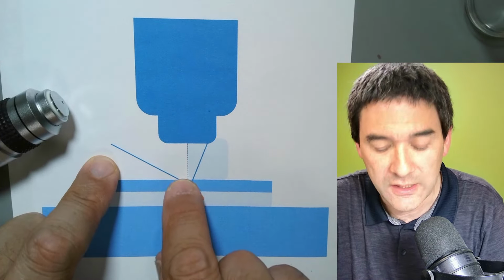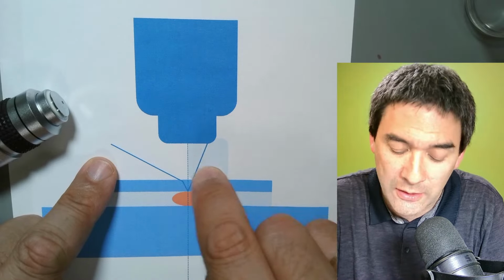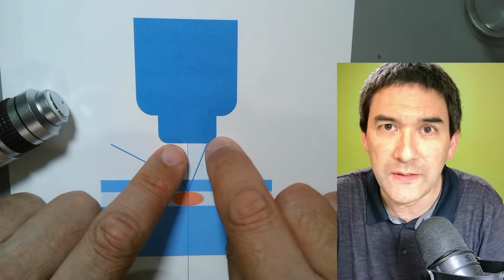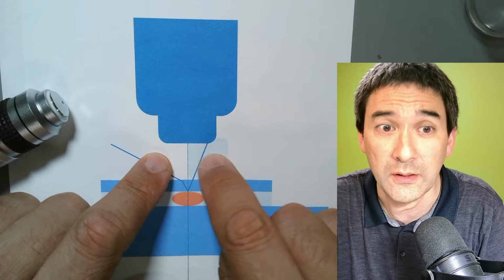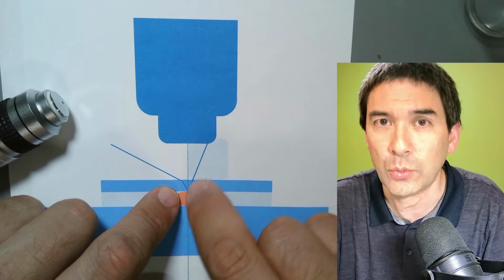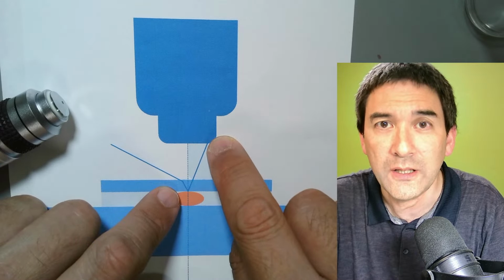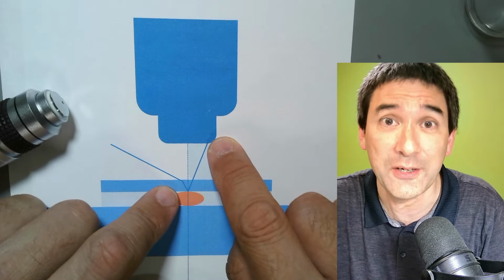This basically means that the image is going to be darker and also of lower resolution. And if you now add immersion oil directly on the objective, you see that the objective is actually covered in oil. So this light blue part is oil. Then the light travels more or less in a straight line, and it is still able to go into the objective. So the resolution is better and also the brightness is higher.